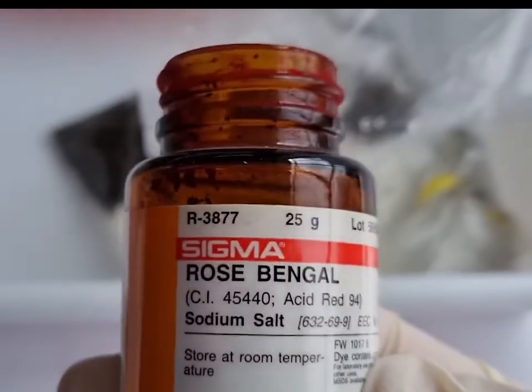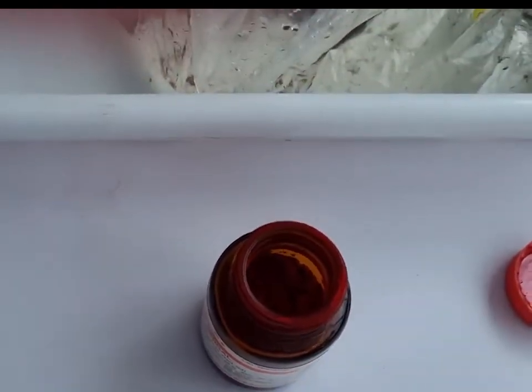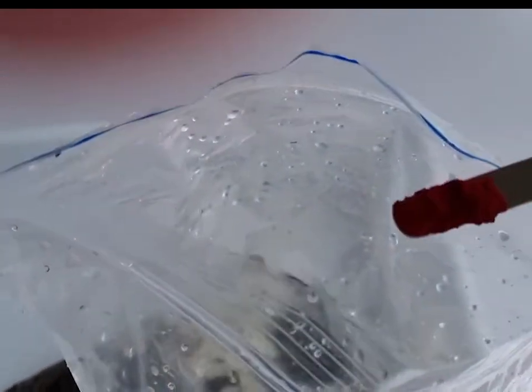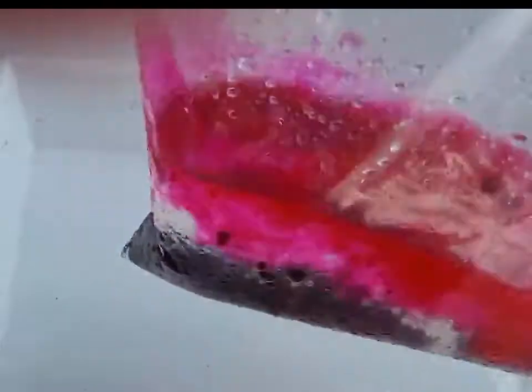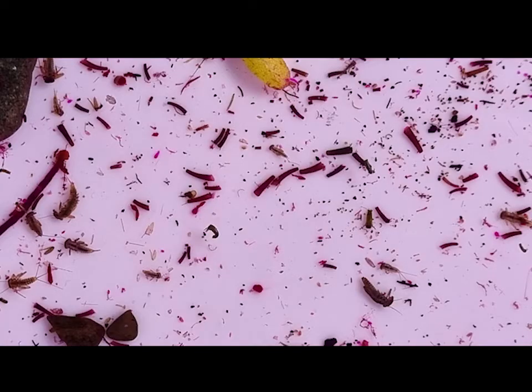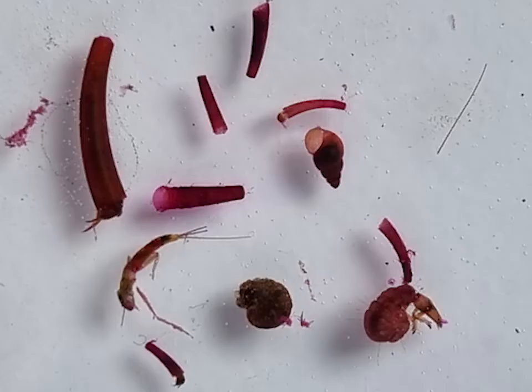There are other methods you can use to help you pick, and one of them is to actually stain your samples. In this case I've used Rose Bengal, which is a pinky-red stain that dissolves in the water and is then taken up across the invertebrate and animal membrane. You probably need to leave it in the Rose Bengal for a while for the stain to take. Here are some examples of what the animals look like after they've been stained — a lot of the animals have got this sort of pinky-red colour. The idea behind staining is to make it easy to see the animals.